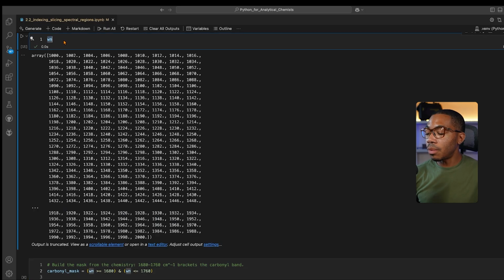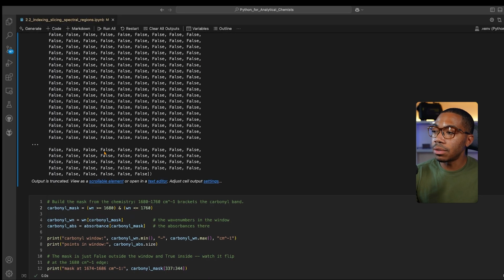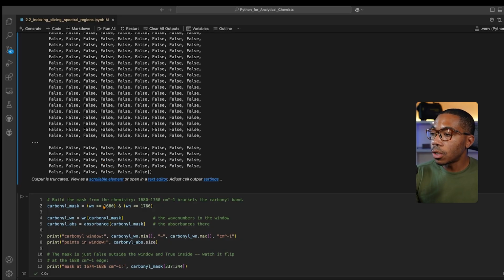So let me illustrate what that looks like. And this is definitely how I recommend using these notebooks. No need to rewrite the scripts. It's really about trying to understand how we can take these lessons and then apply them to your own space. So if we look at the mask, we're going to get an array of true and false values. And that is going to correspond to where these conditions are true or false.